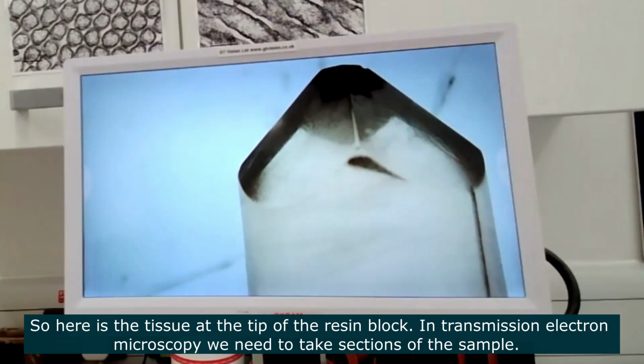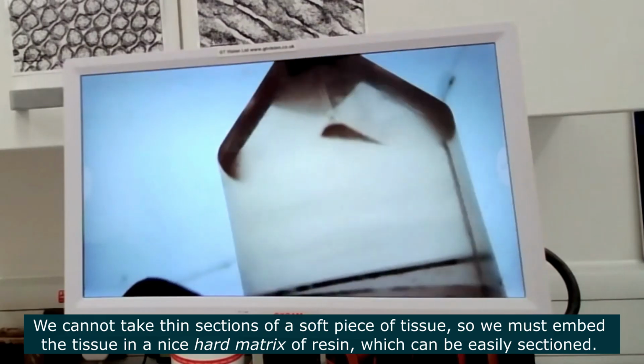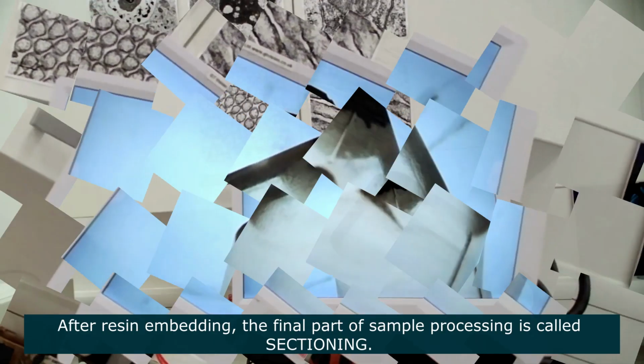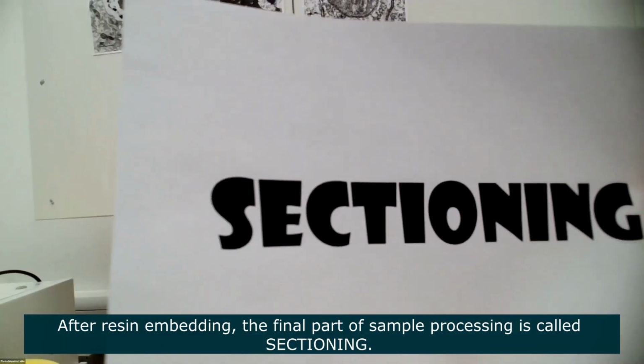What we do in transmission electron microscopy is we have to take sections of the sample. And we can't take sections of a piece of tissue that's all nice, mushy and squashy. It's very difficult to take sections of it. So we have to embed the tissue in a nice hard matrix. And this hard matrix is this block of resin. So we embed the tissue in resin. And then the final part of it is what we call sectioning.